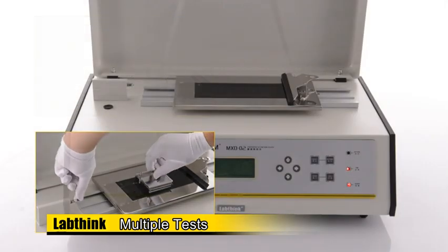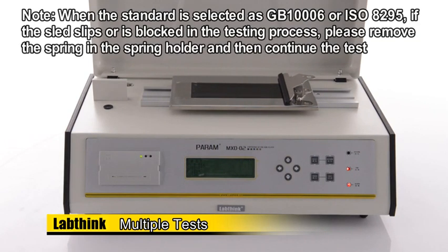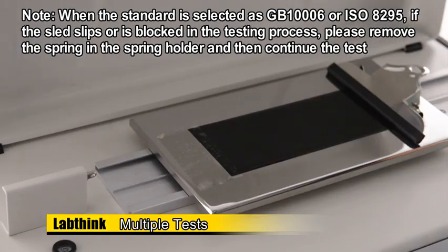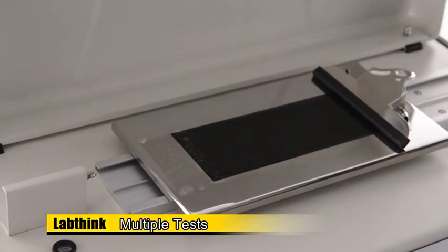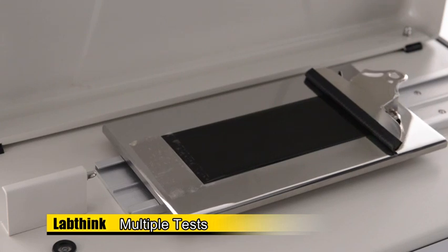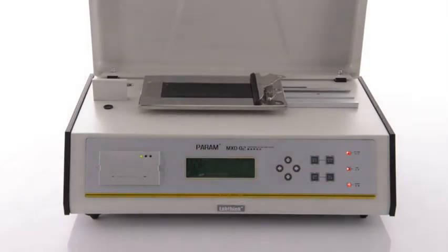When the test is finished, please remove the steel wire and the sled. Press Return so that the test platform will be returned to its original position, and when the indicator light on the right side of the instrument is on, it will stop. Continue to test other specimens according to the procedures above.